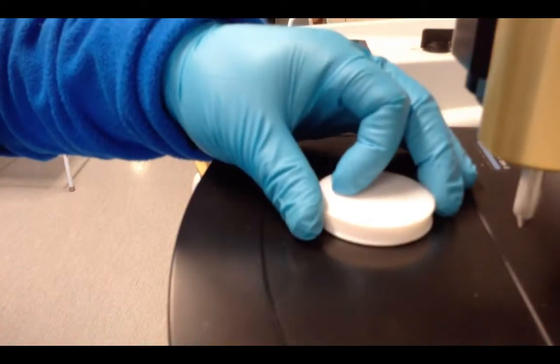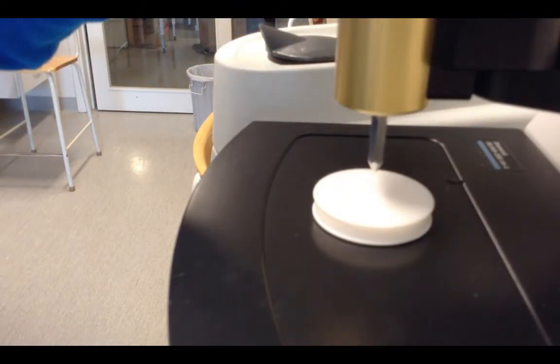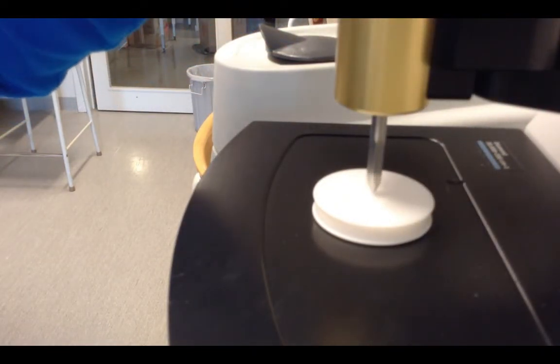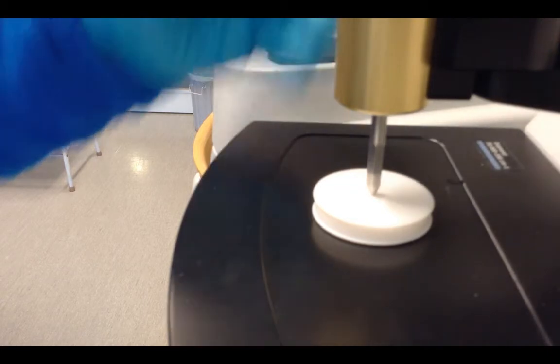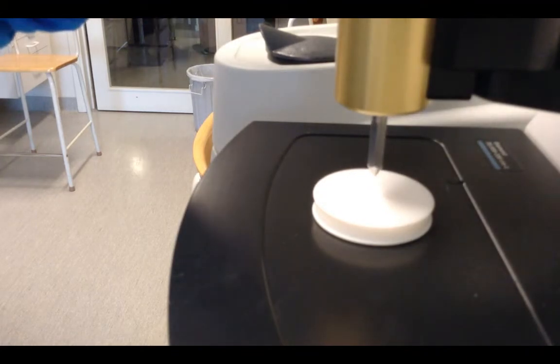Put the cover and load the tip on the cover. After that, you can just use the software to do a measurement scan.